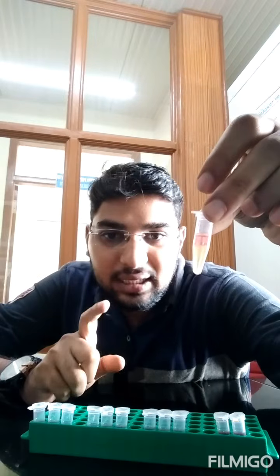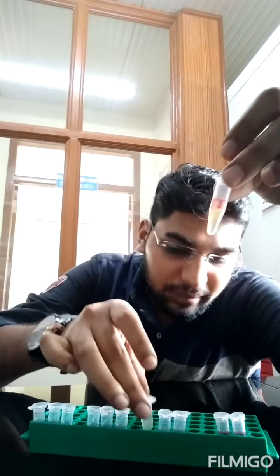So friends, after giving it vortex, just leave it for 5 minutes. You can find beautiful layer separation. Can you see the upper pinkish layer? That is called the chromophore layer because that is colored, and it is the toluene that has it. Similarly here also, very slight pinkish you can see, but in sync, so beautiful layer you can find.